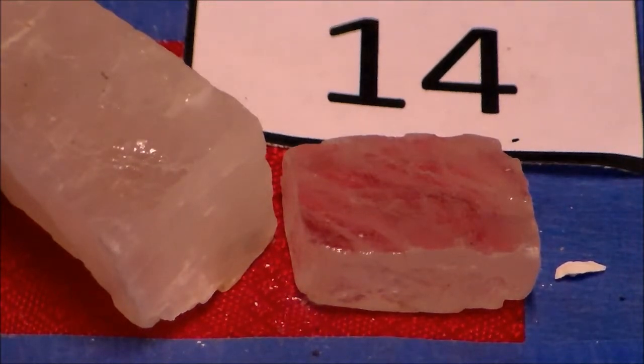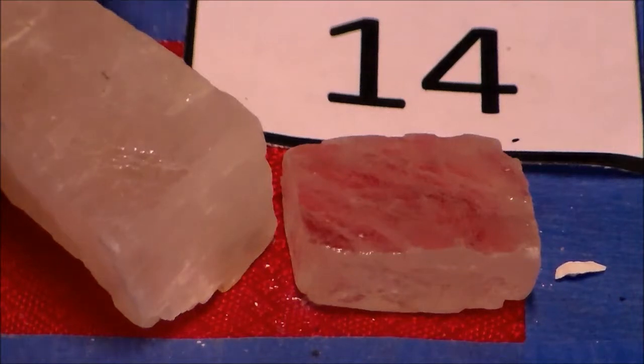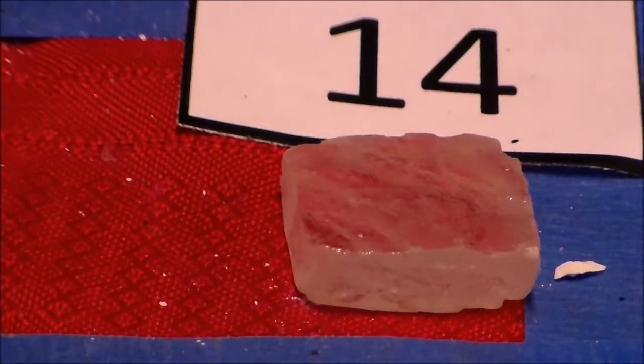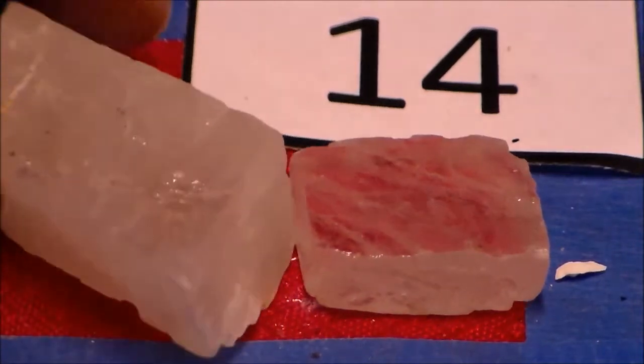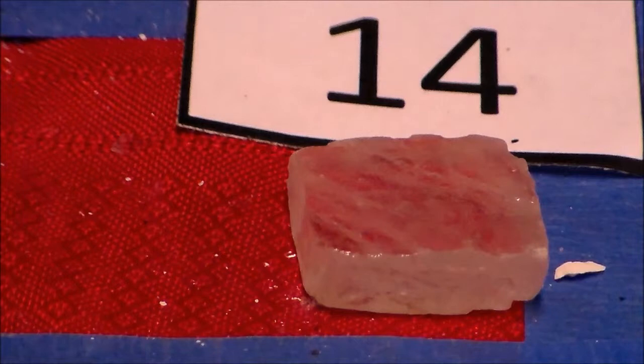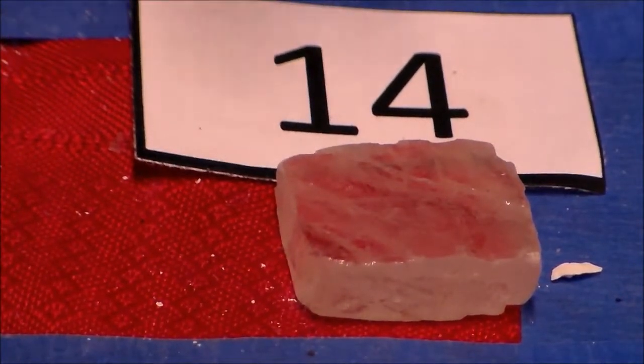Our hint was that we had cleavage at 3 90-degree angles. The one that's fizzing has 3 at 75 degrees, which would be more like a parallelogram. So this does not taste like salt. This reacts with acid, so I'm going to move this off to the side. So our sample 14 will likely taste like salt.